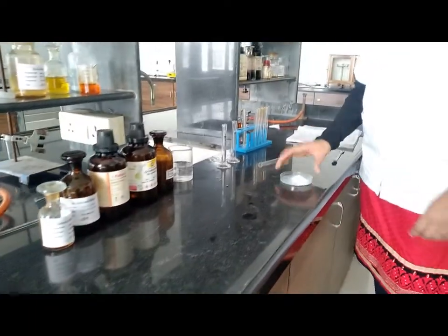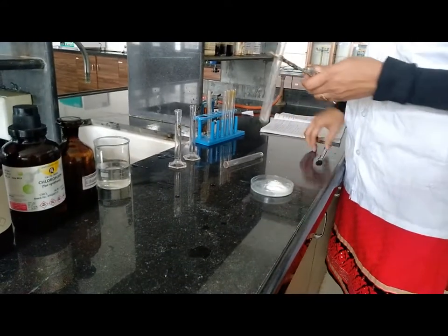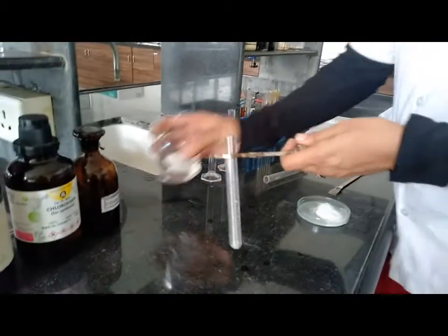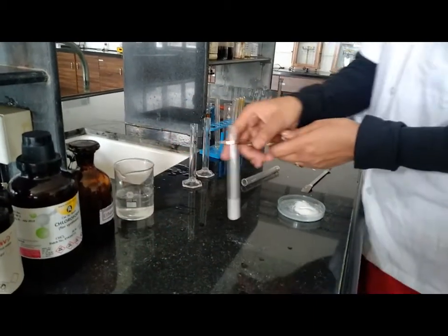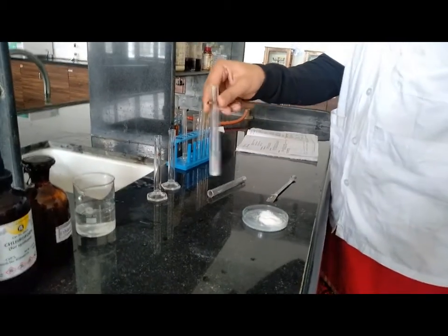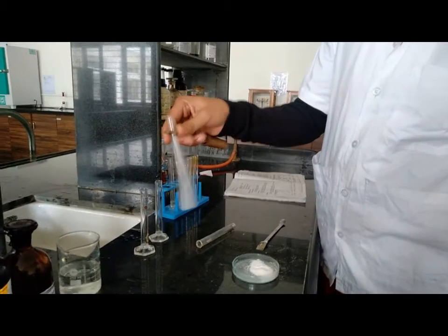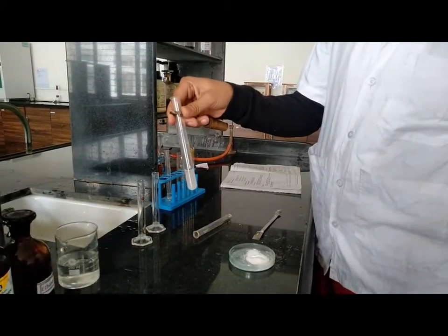Now let's start with the solubility test. We have to perform solubility in different solvents. Take approximately 0.1 to 0.2 grams of sample, then add water and check the solubility. Shake it properly and then check — in water it is very slightly soluble.